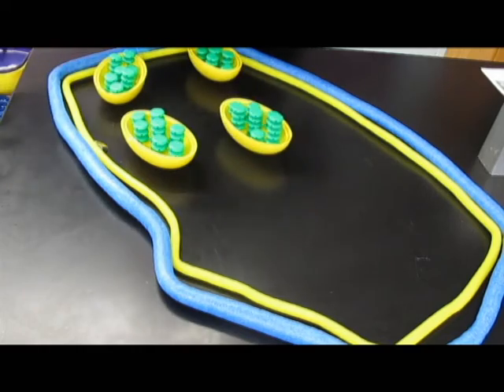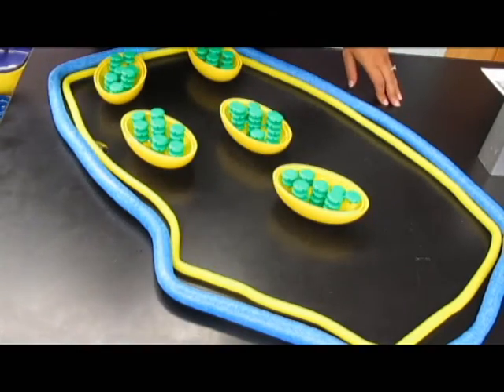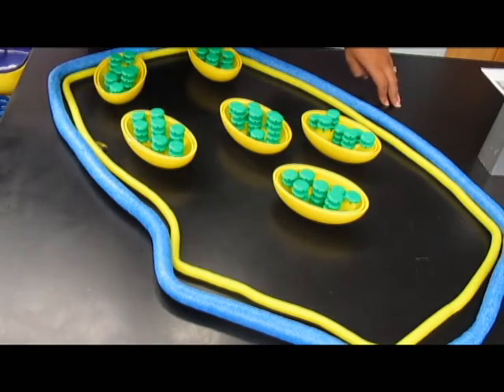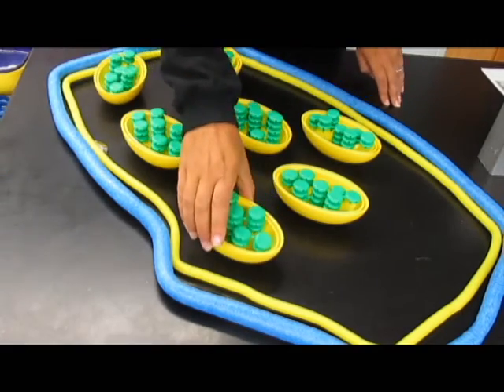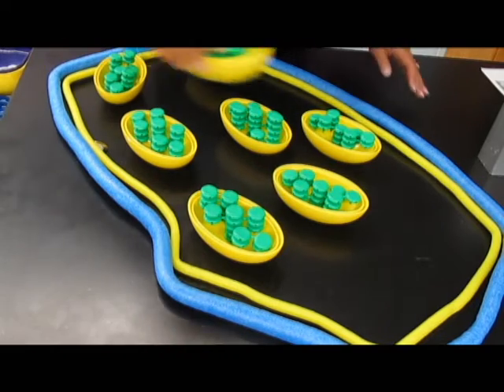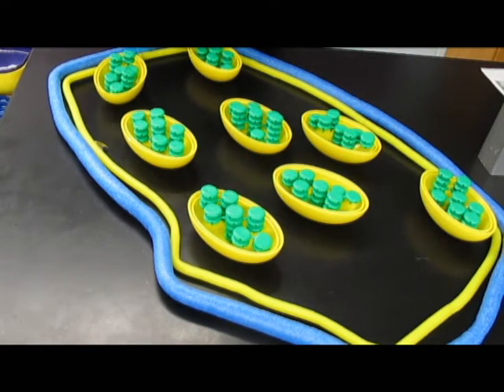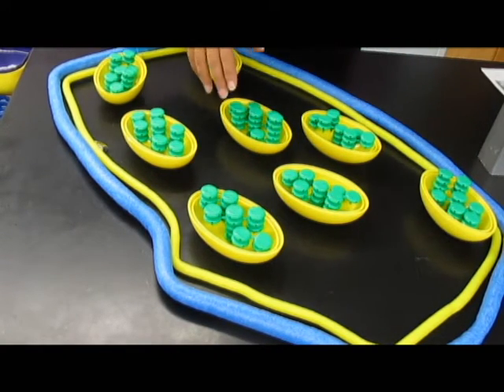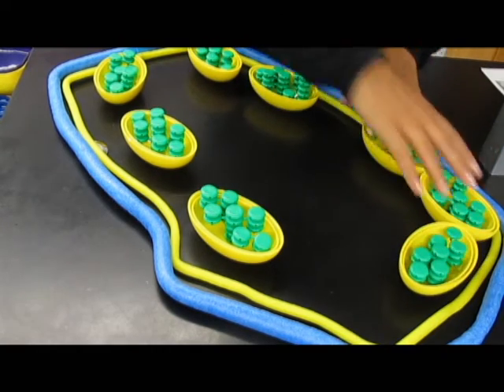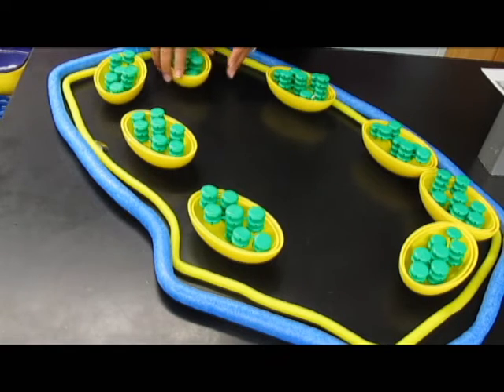Students might just stick them anywhere at first. You might need to ask them if the chloroplasts are really in the middle of the cell — and they might be if students are focused on the top or the bottom. Students can usually focus somewhere in the middle, notice that there's an emptiness there, and then move their chloroplasts to where they actually see them in the cell.